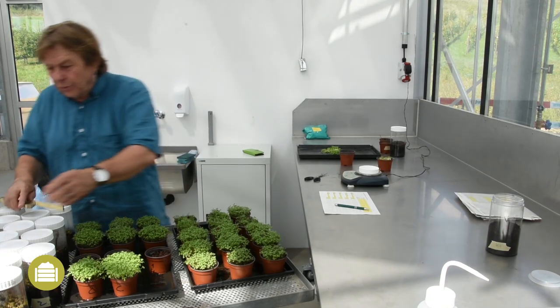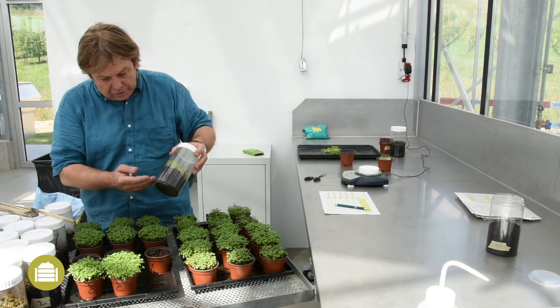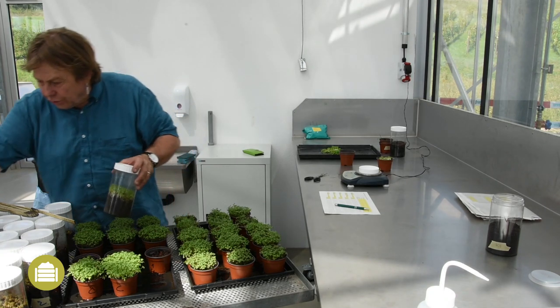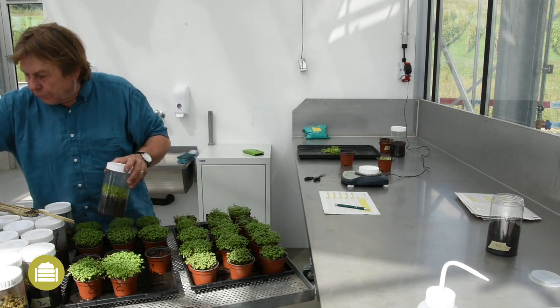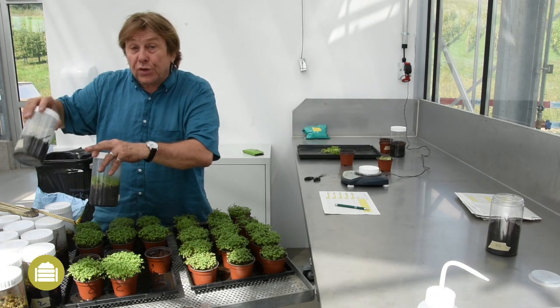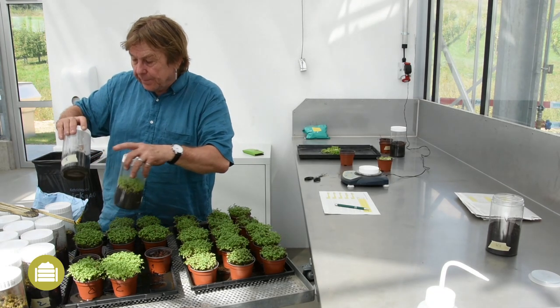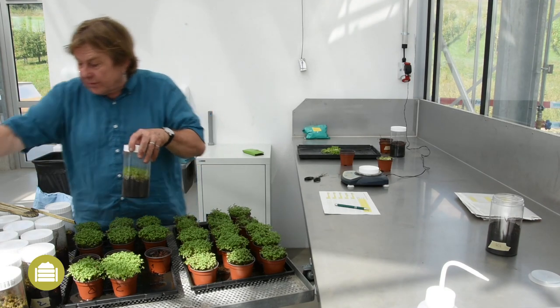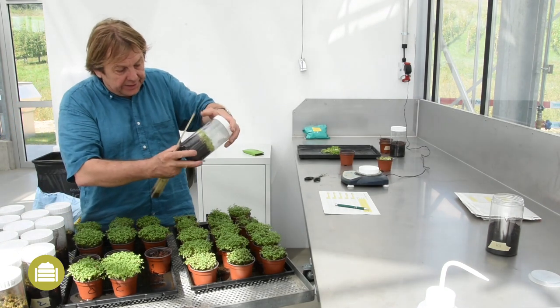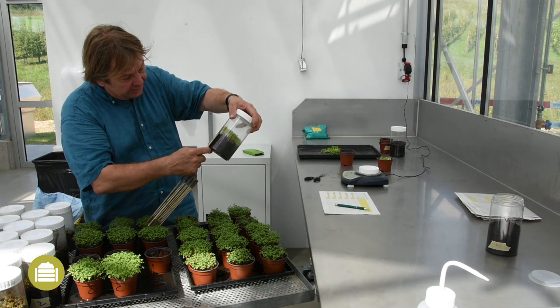In the closed test, you can see here the good growth of the roots on the reference substrate, whereas on some compost substrates the growth was much less. This test is really more sensitive than the open test. For the evaluation, I measure the average length of the roots, then I calculate the percentage of the root length compared to the length on the reference substrate.